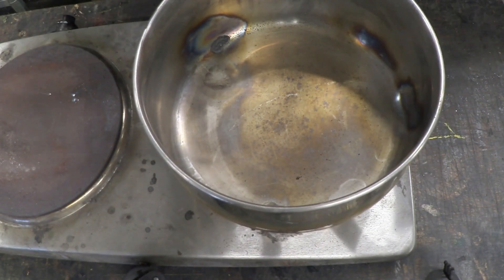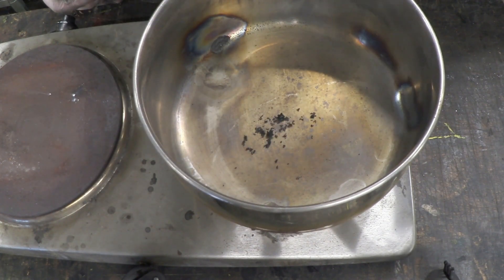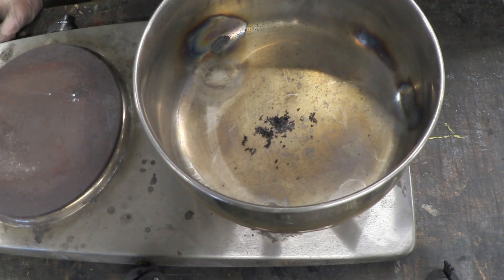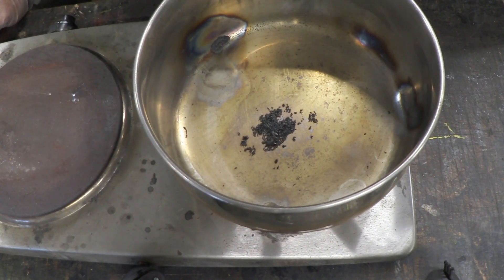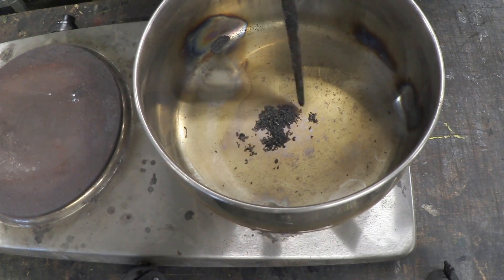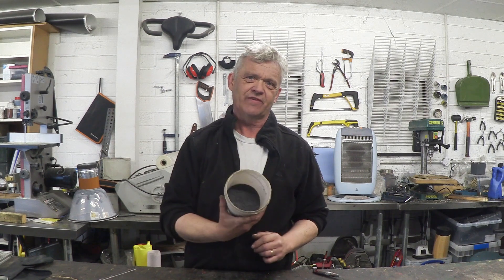But I love this bit, so I'm going to give you a close-up of it. All we're looking at is a pan on a hot plate, and I'm going to put a bit of this stuff onto that hot surface. Now, it's not normal to do it like that — it would be a bit slow. What you actually do is bang it in a kiln at 500 or 600 degrees centigrade, and the whole thing goes whoosh, and you get this big mass — you end up with a bucket full of exfoliated graphite.